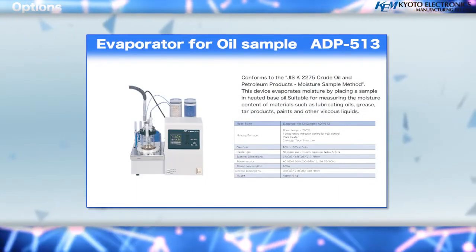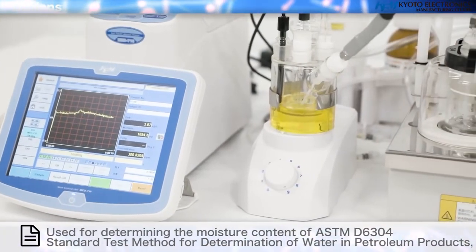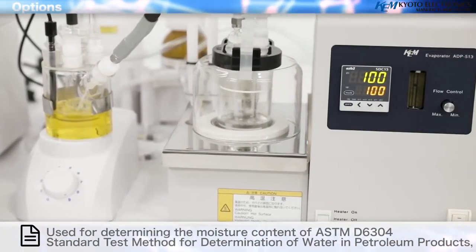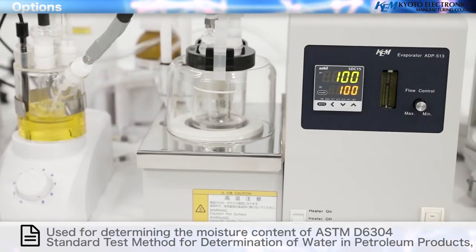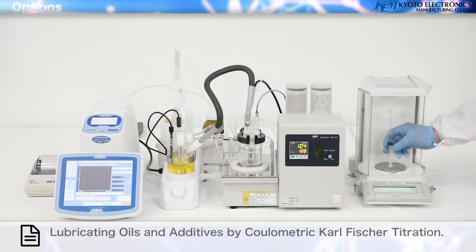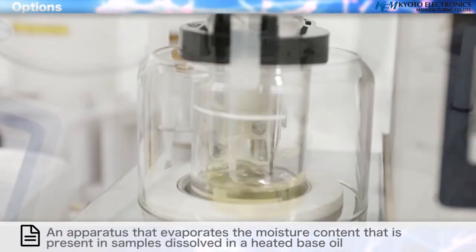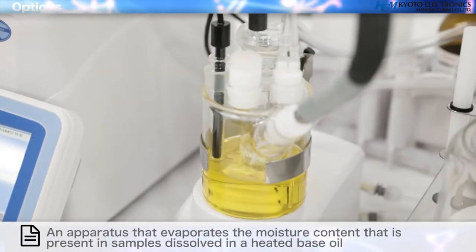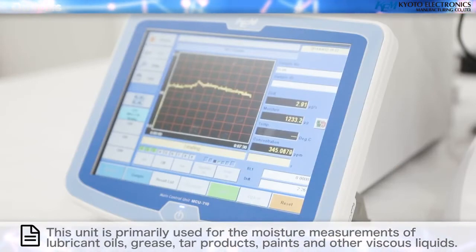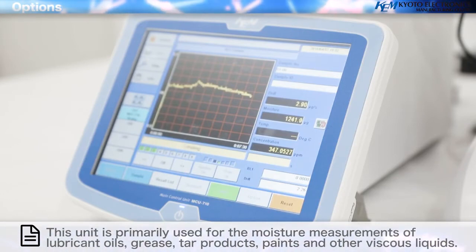Evaporator for oil sample, ADP 513, Non-CE. Used for determining the moisture content of ASTM D6304, standard test method for determination of water in petroleum products, lubricating oils, and additives by Coulometric Karl Fischer titration. An apparatus that evaporates the moisture content present in samples dissolved in a heated base oil. This unit is primarily used for the moisture measurements of lubricant oils, grease, tar products, paints, and other viscous liquids.